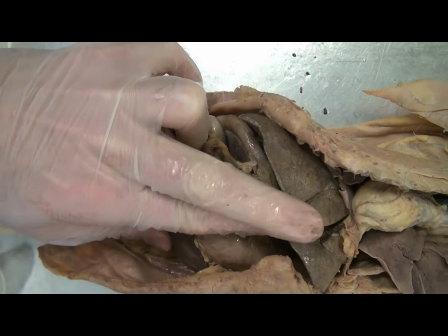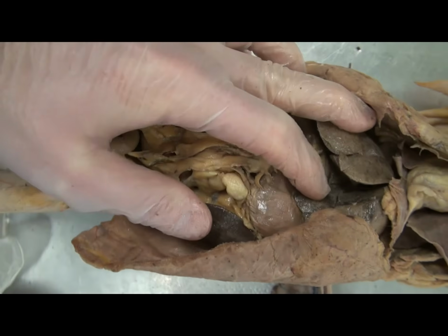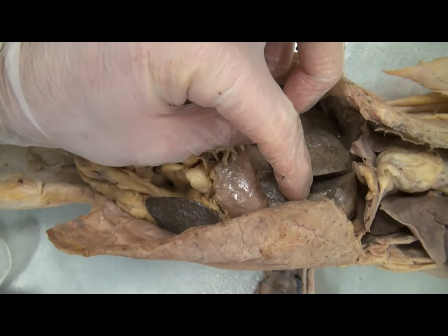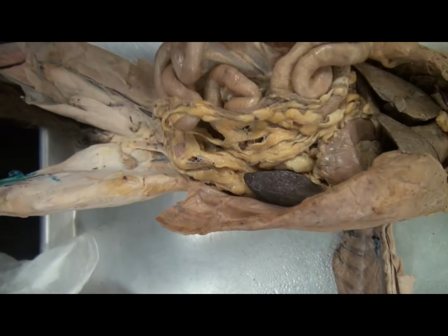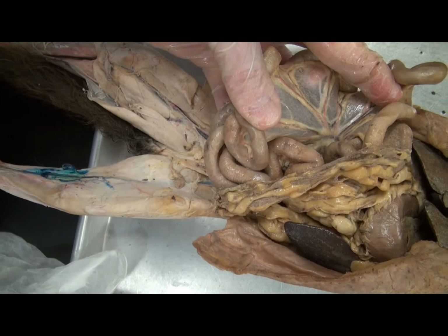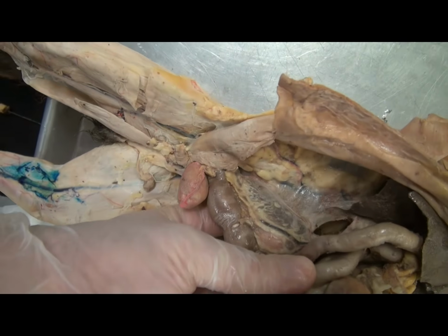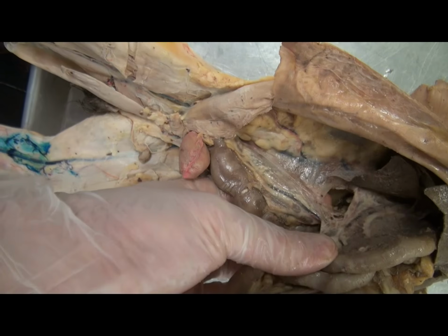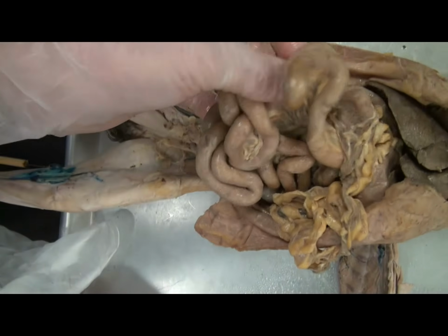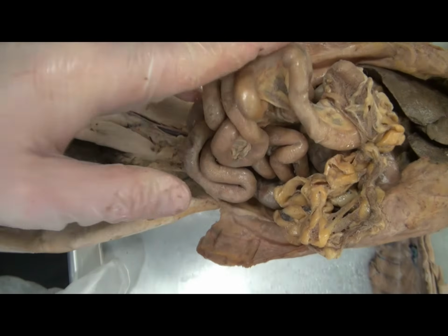Between the lobes of the liver, there is a falciform ligament, which separates these lobes and then anchors the liver to the body wall. Between the folds of the small intestine, these loops, we can see the mesentery, right? And then anchoring the large intestine, we can observe the mesocolon. So in addition to the serosa layer of the visceral peritoneum, there are also extensions of these which help to anchor these digestive organs.